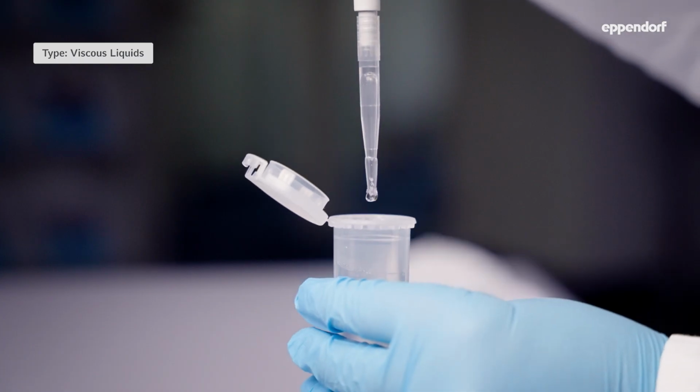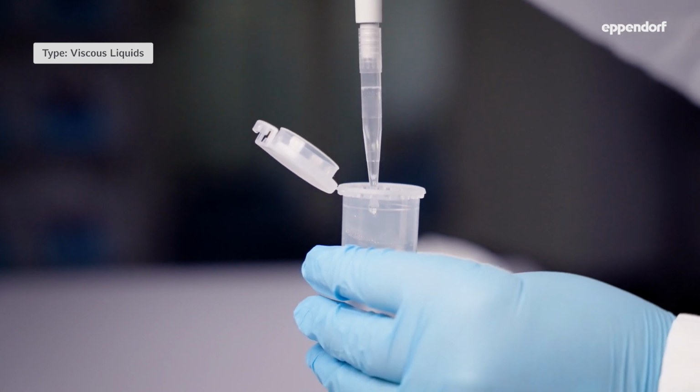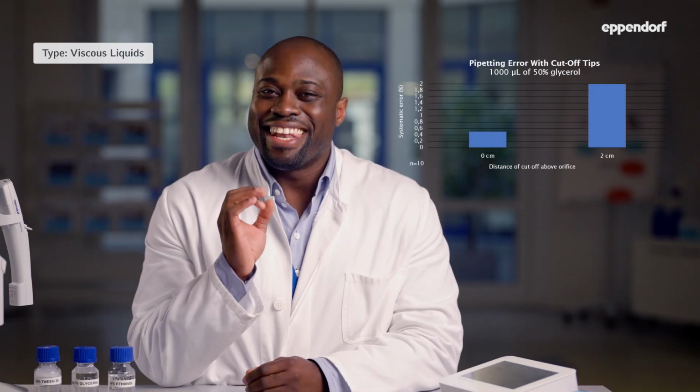Is your sample thick with a high flow resistance? If so, it's probably a viscous liquid like glycerol, blood or oil. The usual challenges with those are air bubbles inside the tip, liquid slowly flowing out of it, or liquid remaining inside the tip after pipetting. Before we talk about those and how to solve the problems, it's important to remember: never, and I mean never, cut off the pipette tip. That will always lead to inaccurate results.